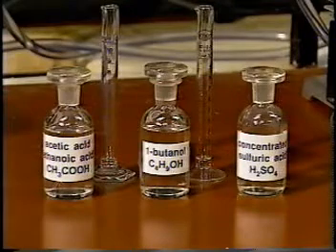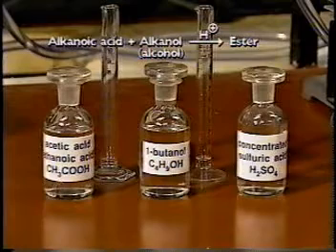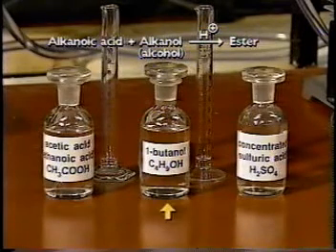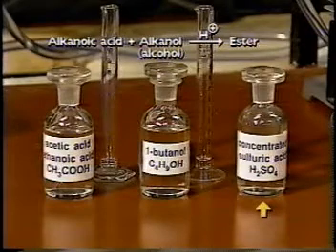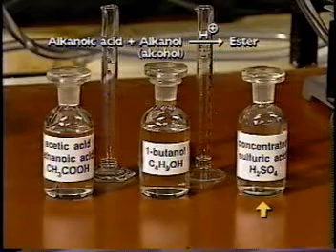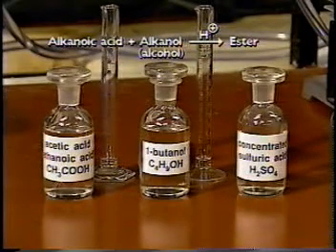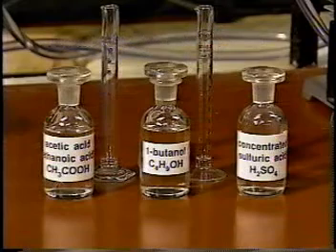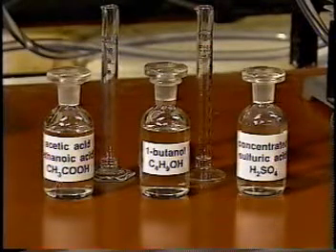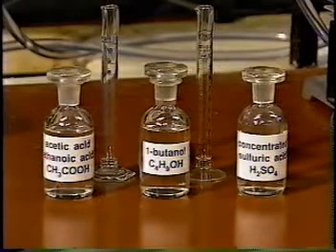We'll start by making an ester. Esters are formed by the reaction of an alkanoic acid with an alkanol or alcohol in the presence of a catalyst — in this case, a strong acid. The process is called esterification. We're going to react ethanoic acid with 1-butanol using concentrated sulfuric acid as a catalyst to form the ester butyl ethanoate.